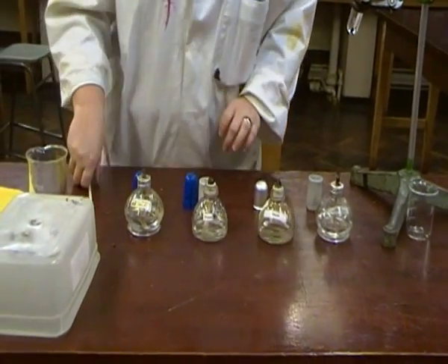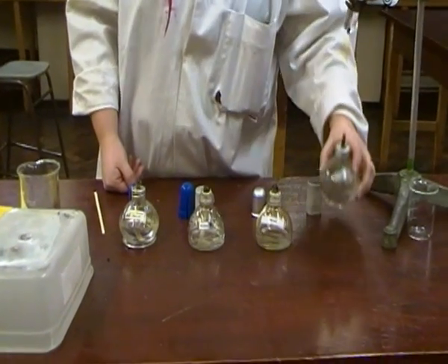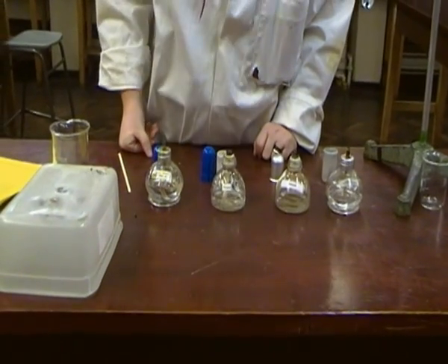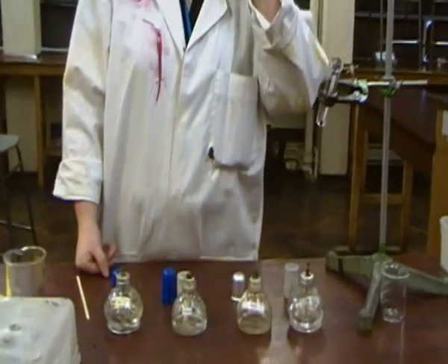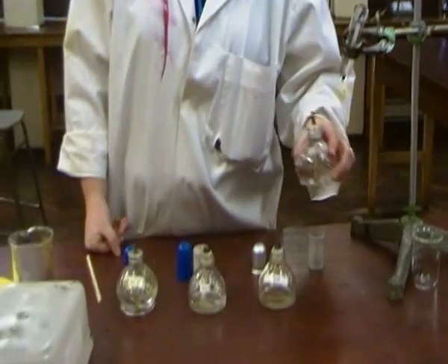Alright, now what you would do is measure the weight, the mass of each of these and then burn them to heat a fixed amount of water for each one of them, let's say 25 centimeters cubed of water in a test tube. And then once that temperature of that test tube has increased by 50 degrees Celsius, you would weigh this again.